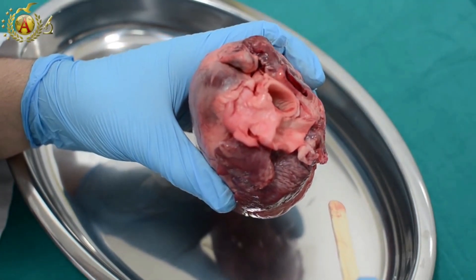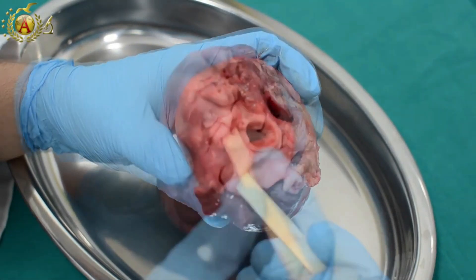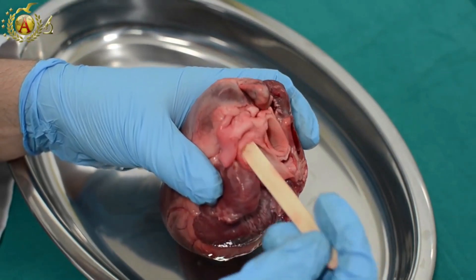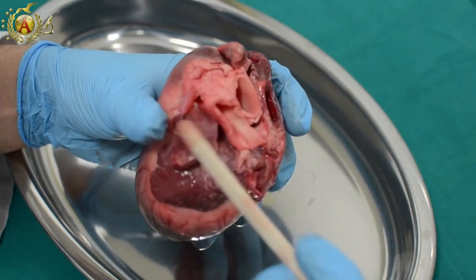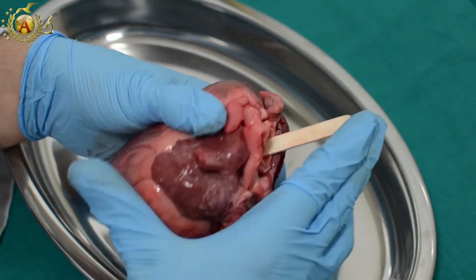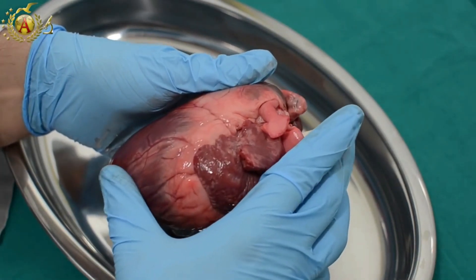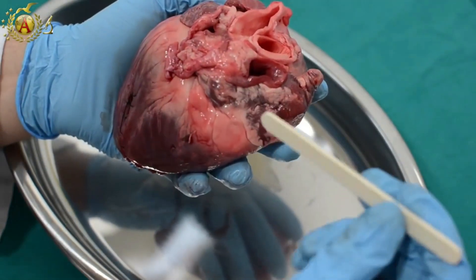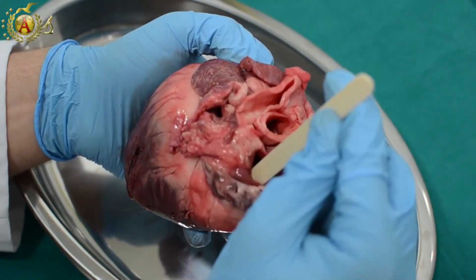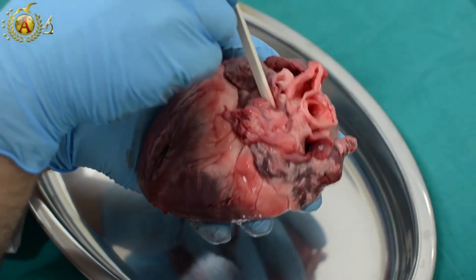Observing the base of the heart, vascular structures that enter and exit it can be seen. This is the pulmonary trunk, and we know that by the fact that by inserting a probe in it, we can touch the right ventricle. Immediately behind the pulmonary trunk is obviously the aorta, and we know it is the aorta because by inserting a probe in it and pushing, we wind up along the wall of the left ventricle. We can then see a series of venous structures at the base, like the superior vena cava — and therefore we are in the right atrium — or the pulmonary veins, and here you can see two of them.